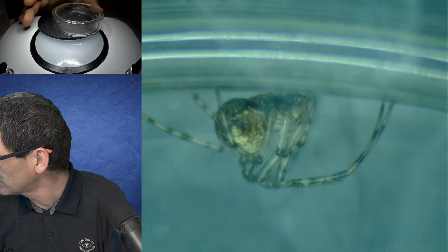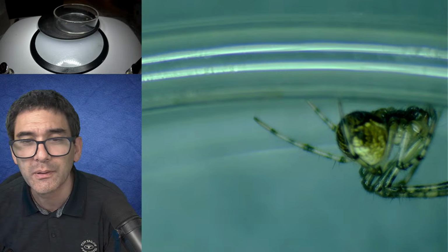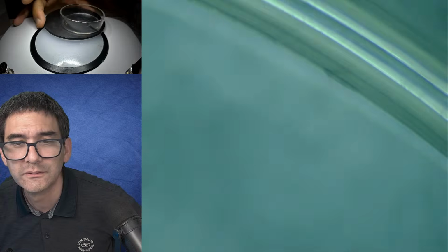Quite interesting. And you know what I'm going to try to do in any case? I'm going to remove the lid now, and this should give us a slightly better image quality. Of course, they might escape, but it's okay. So, here it is. Yeah, it's trying to escape. No, it didn't. Let's go down with the magnification again.